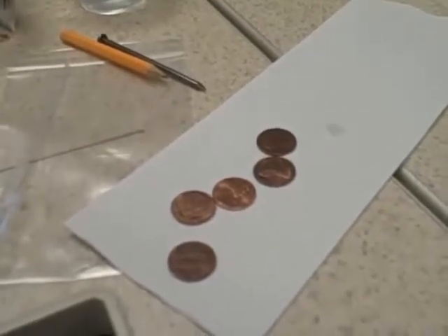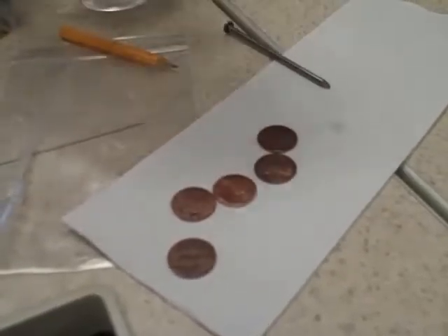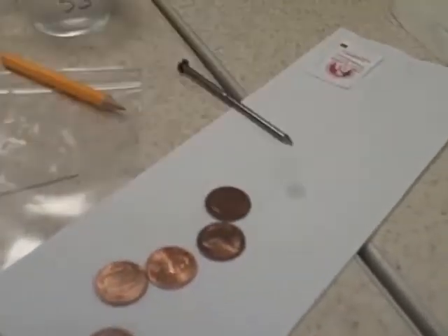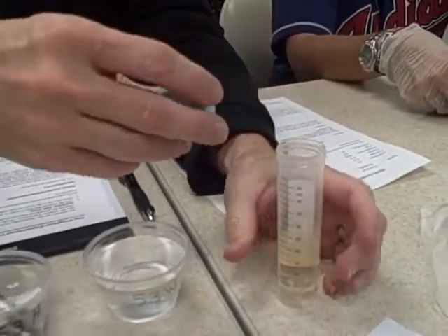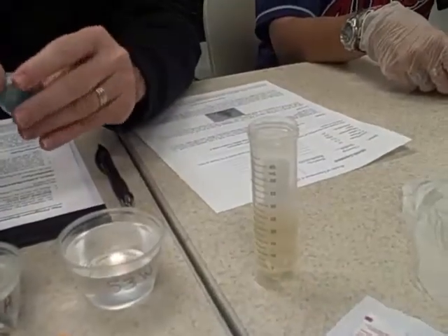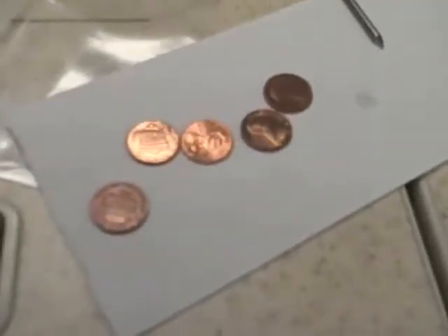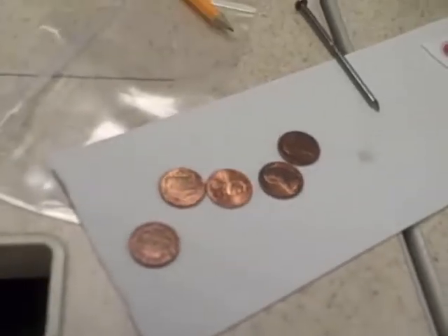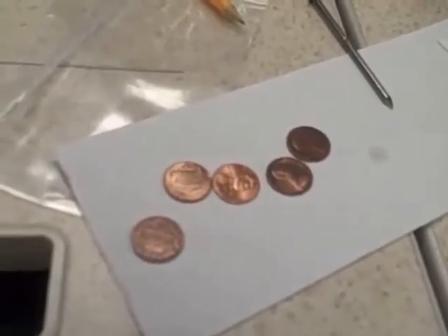The nail that's there happens to be a bright finish nail that has a zinc coating on it. We're going to start by opening the vial marked V, as in Victor. There are 5 pennies there. Now, the 5 pennies tend to be dirty pennies. The dirt is not dirt, quote unquote, dirt. It's copper oxide, copper 2 oxide.